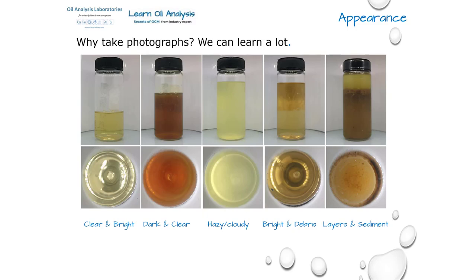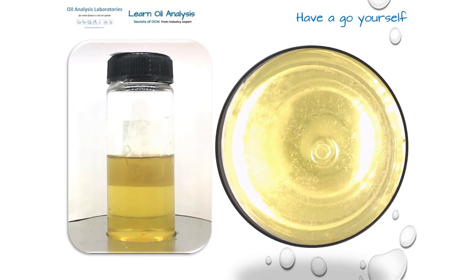You notice this is called layers rather than free water, even though it is free water in this case. Well, the reason for this is until we test the layer, we don't know it is water. We just know we have a denser fluid that is not miscible, i.e. it doesn't mix with the main fluid. So this contamination could be water, glycol, or other lubricating oils. Hence it is best not to guess it is water from appearance alone. So now for you to have a go. Pause now if you need to.